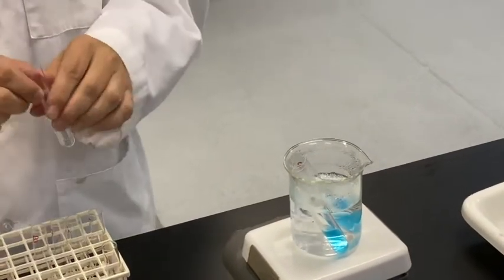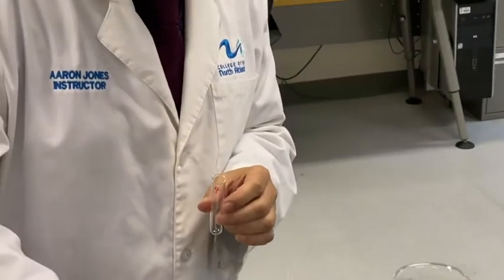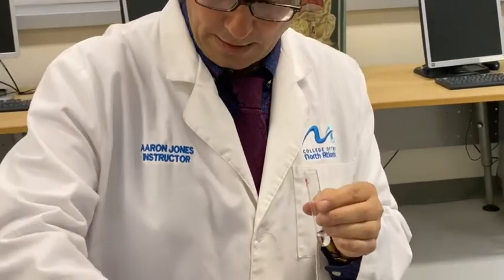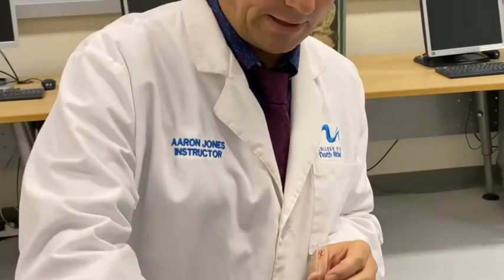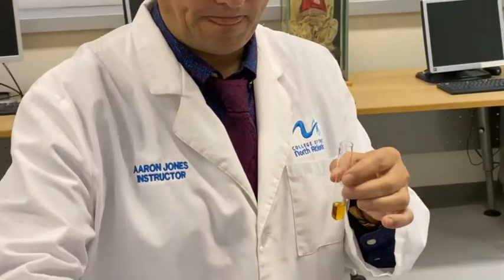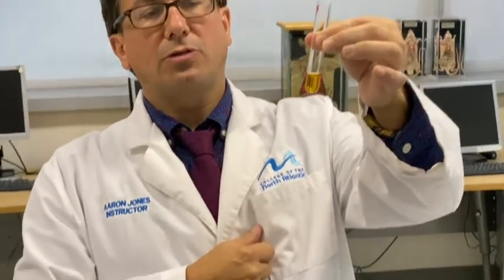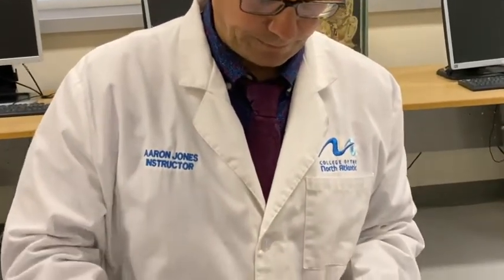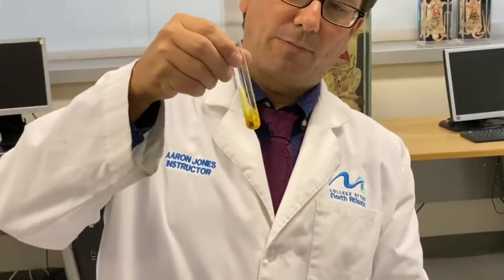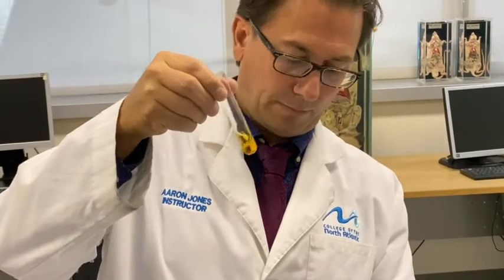Test tube 4 calls for 5 mils of maltose solution, our clear simple sugar solution, and it wants 3 drops of iodine in that. We're going to add the light brown iodine solution to it. And we notice there's no color change. That means there's no starch present. So once again, to repeat, blue-black in the presence of iodine, starch, remaining light yellow-brown in the presence of iodine, there's no starch.